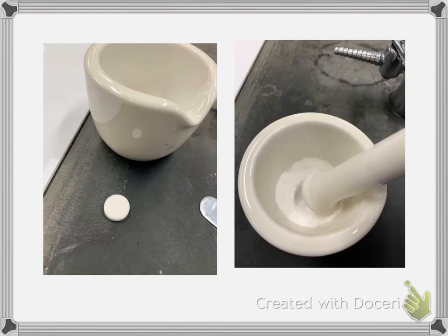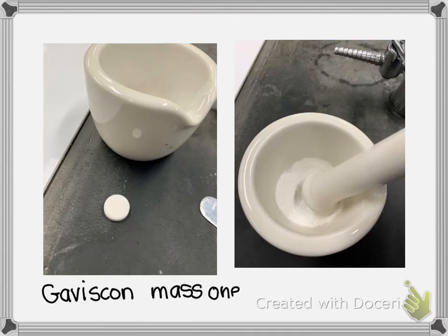And so here, this is the Gaviscon. I did the Gaviscon first. And the mass of 1 dose, and I did 1 tablet because that's what the active ingredients were. You could take 2 to 4 tablets, I think.